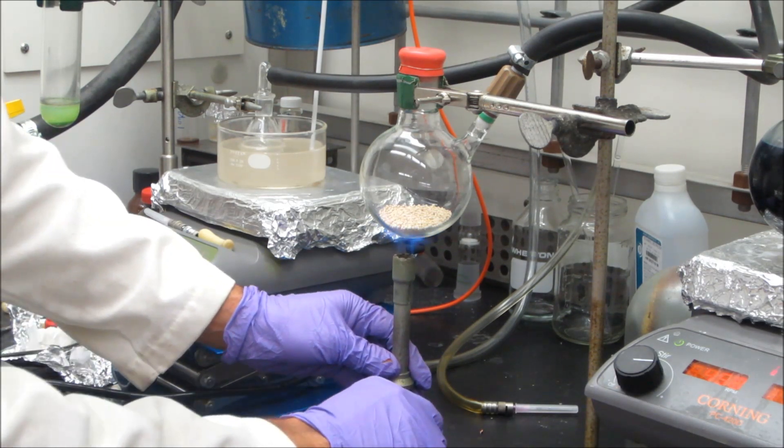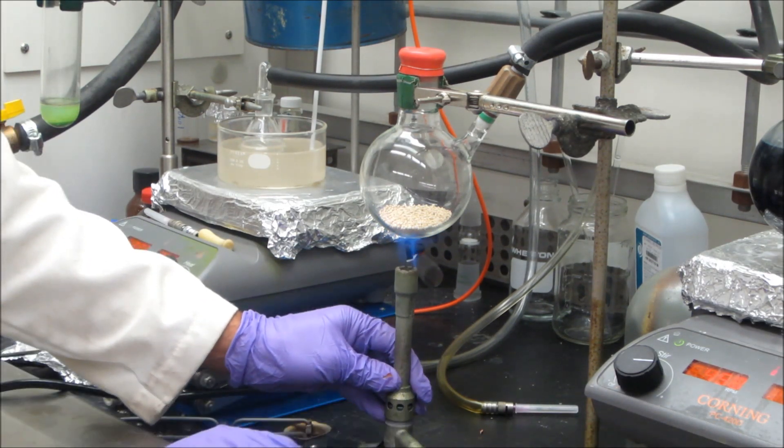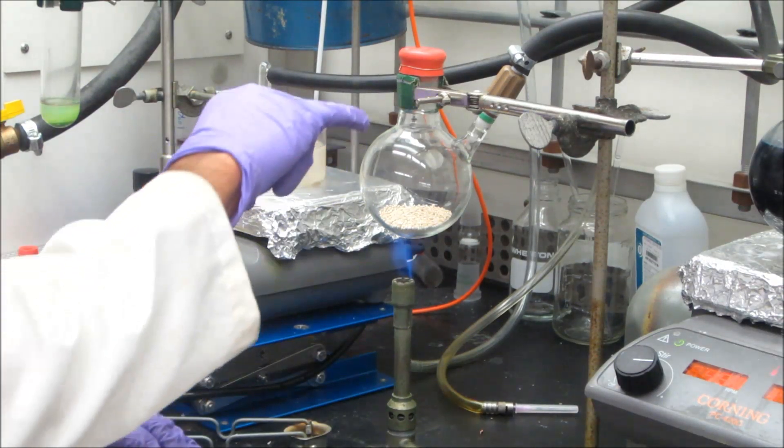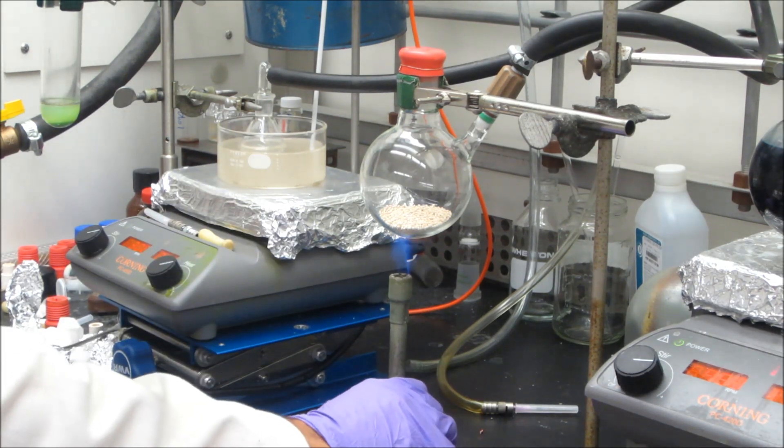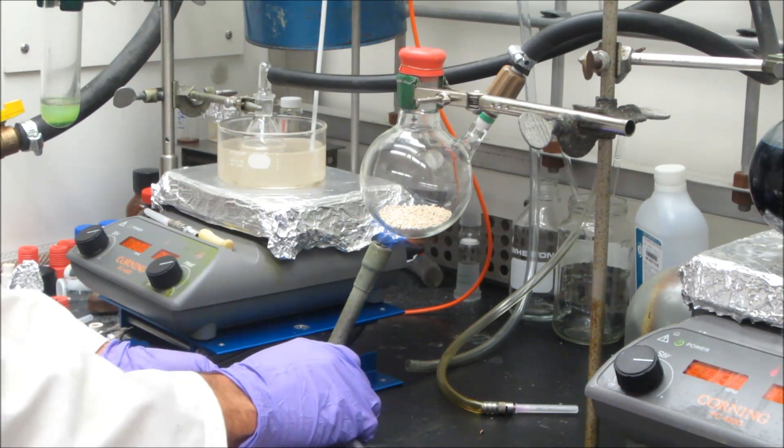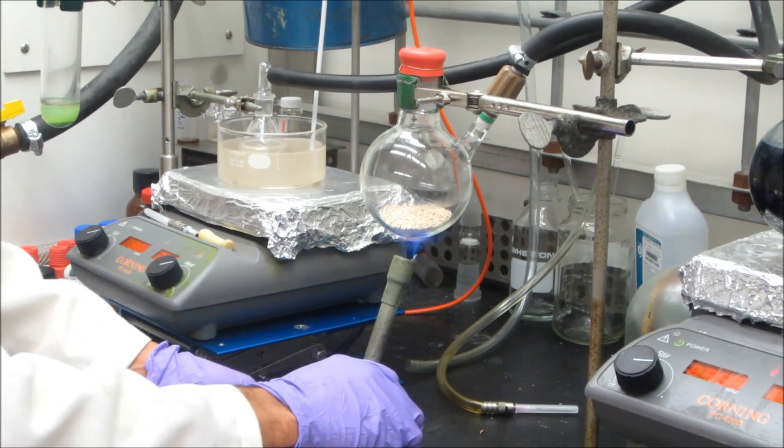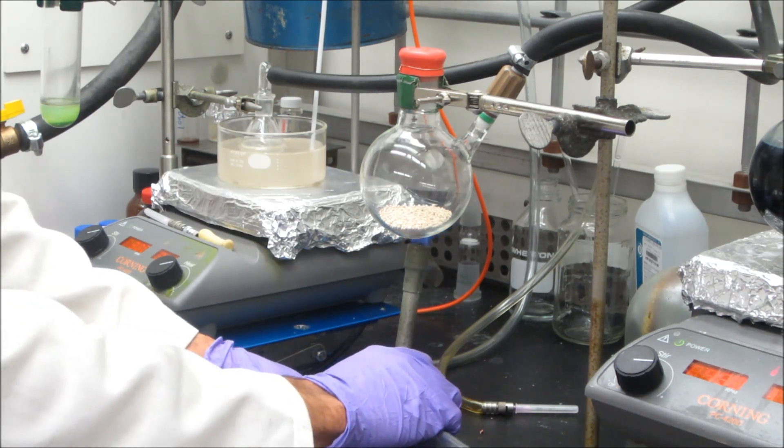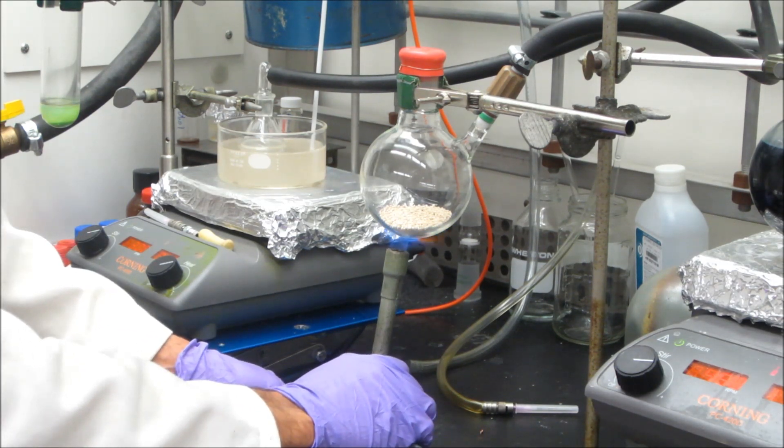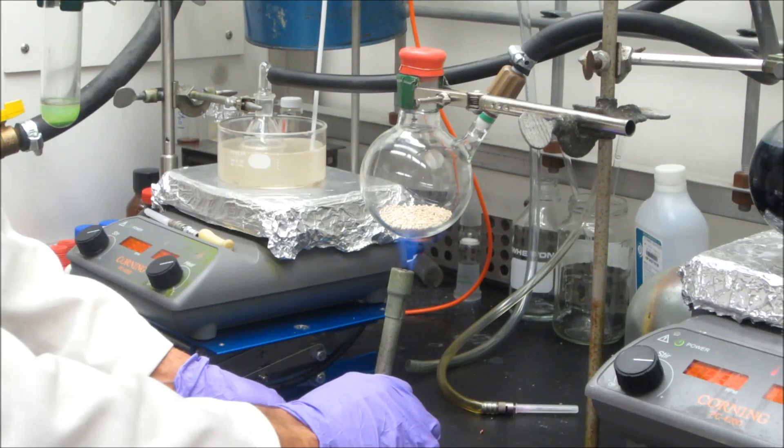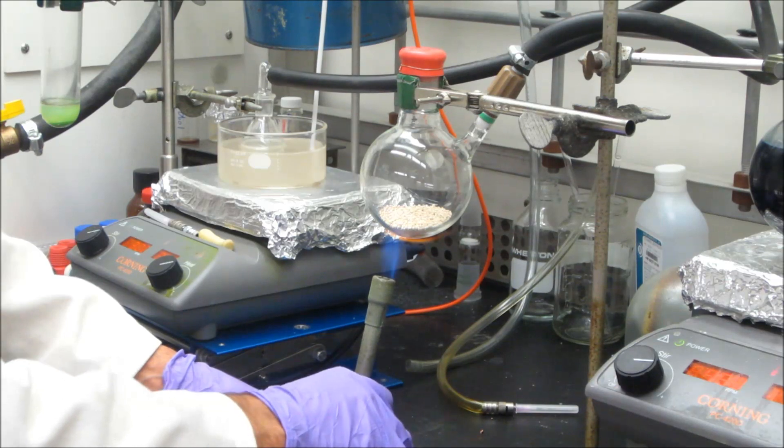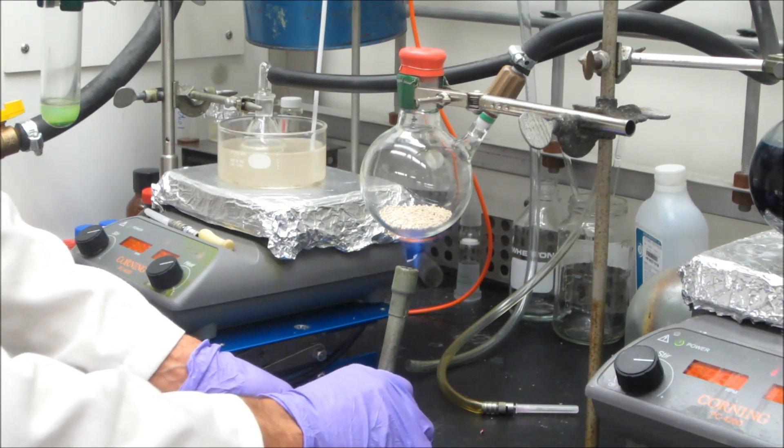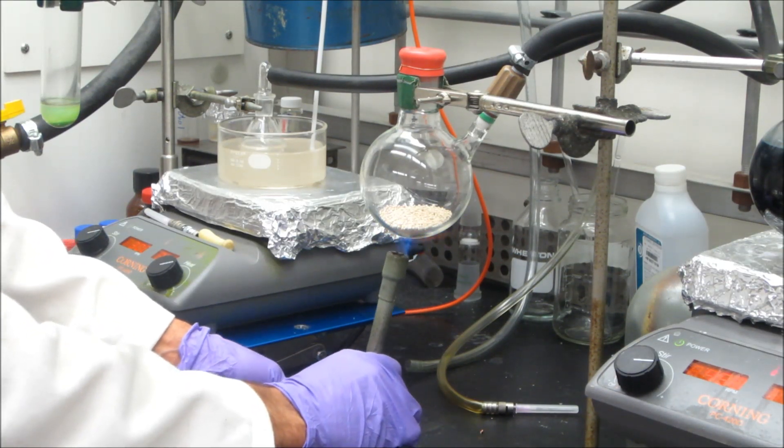And it'll take a minute or so, but you'll actually be able to see water leaving the sieves and then condensing on the cooler parts of the flask. You want to make sure you've got a bright blue flame and really that the cone part of the flame is what's coming into contact with the schlenk flask.